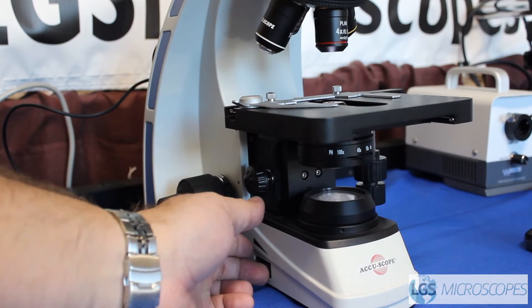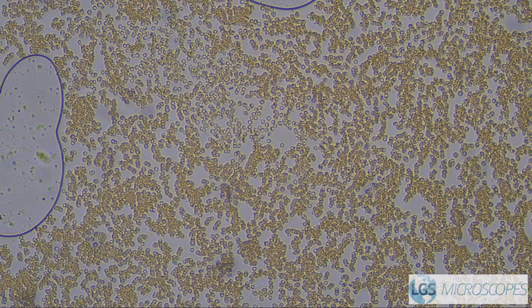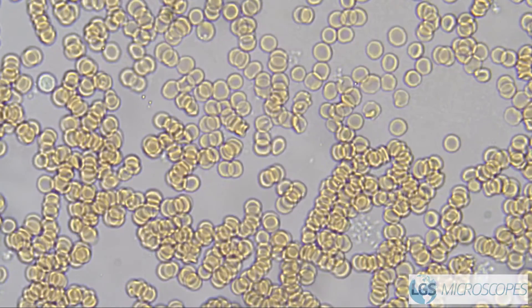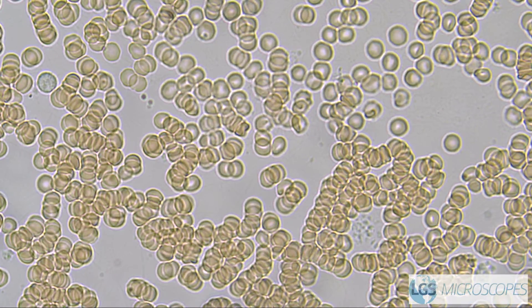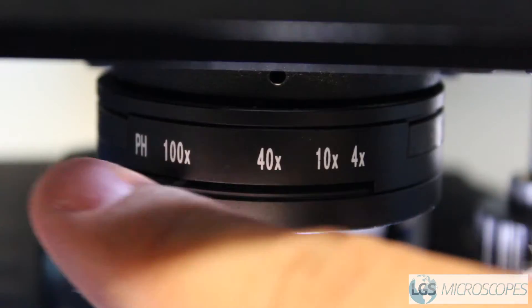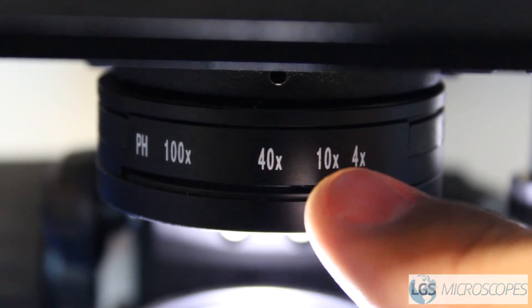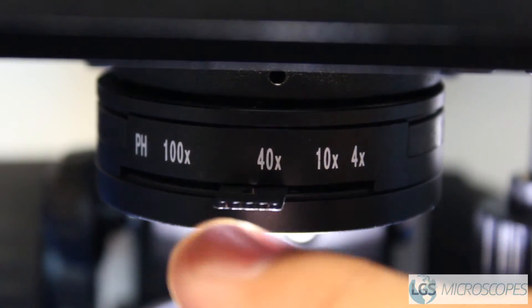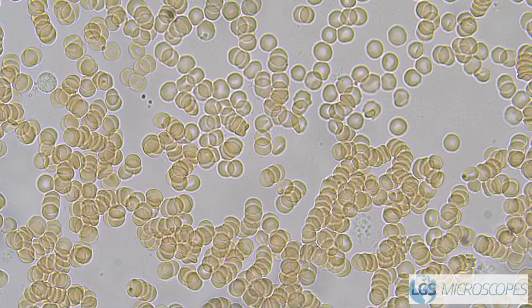Once you find what you're looking for on the 10x, go ahead and swing up to the 40x objective. Now at this point you're going to want to start using the aperture diaphragm, which is located beneath the stage. Go ahead and close that down, and then find what you're looking for.